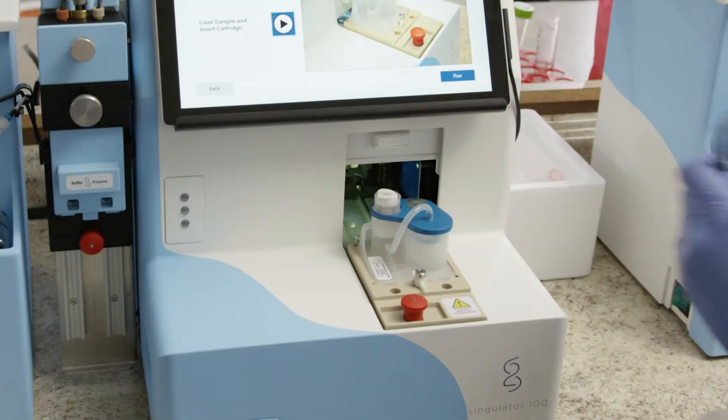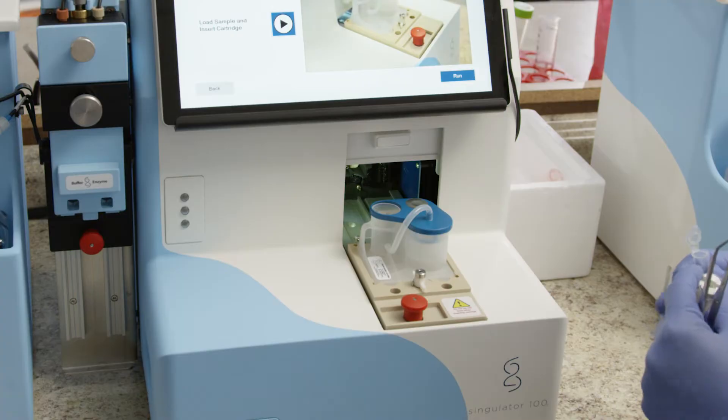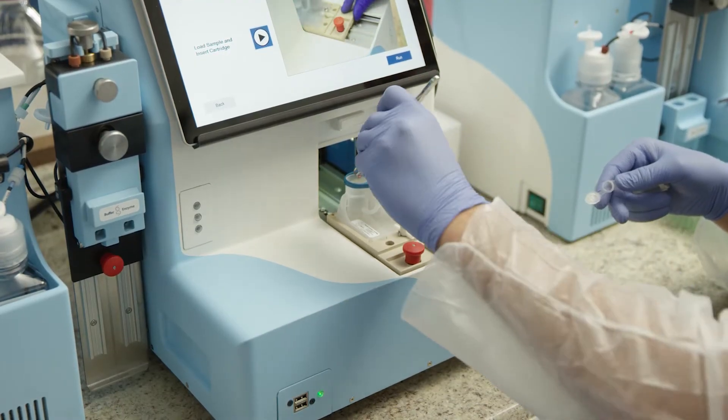Remove the sample disruption cap from a cartridge. Place the sample at the bottom of the disruption chamber and replace the disruption cap.